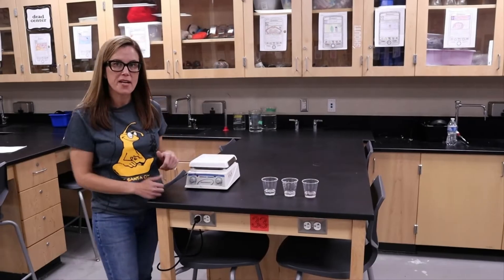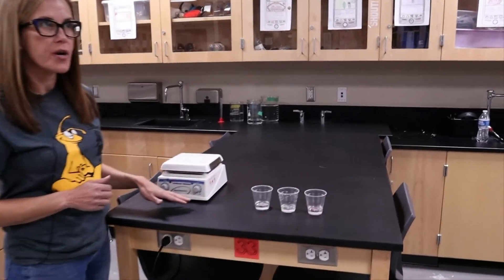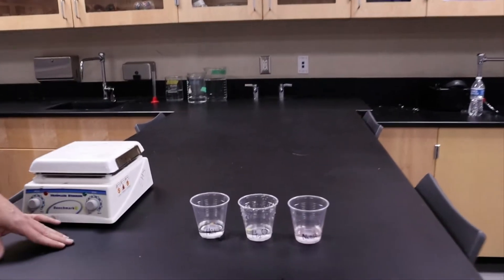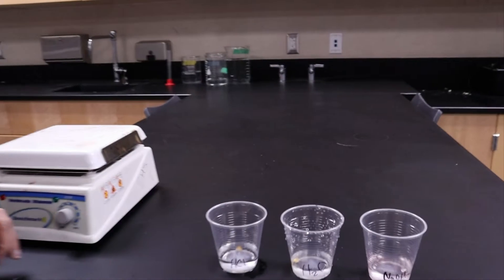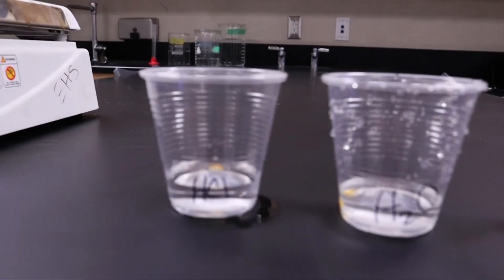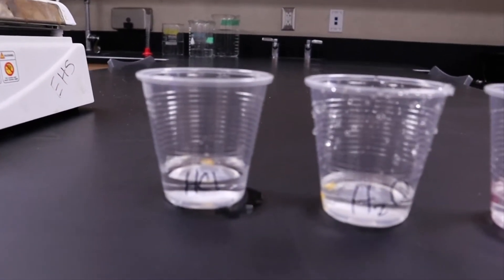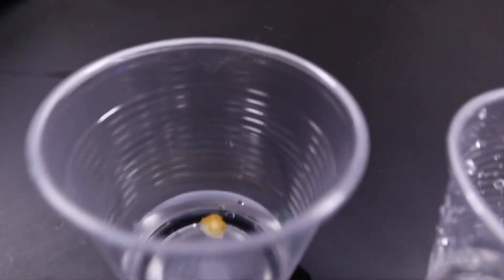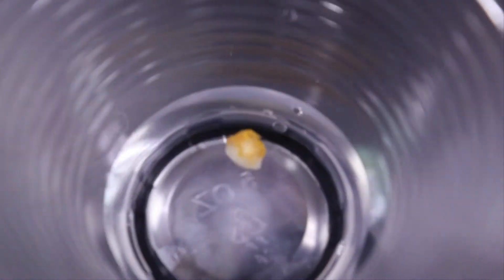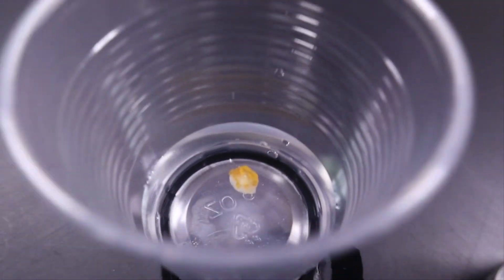After five minutes, these are the results of the experiment for part one. If you look at them closely, the pill in the hydrochloric acid — which represented the stomach environment — nothing happened. It just stayed the same with no changes over the five-minute time frame.